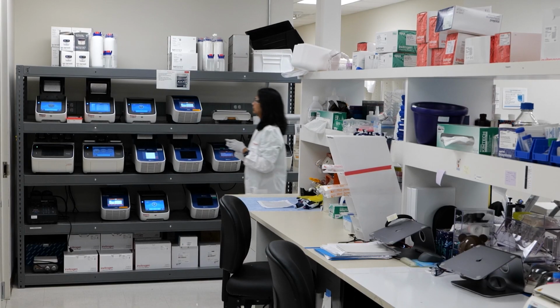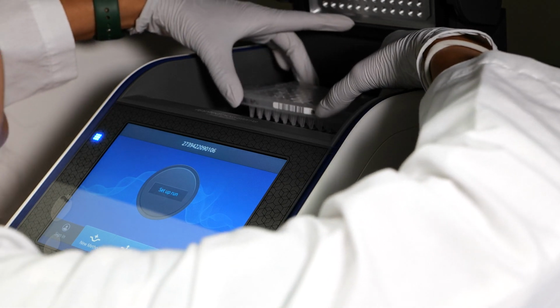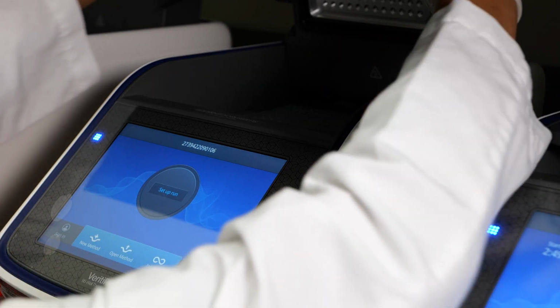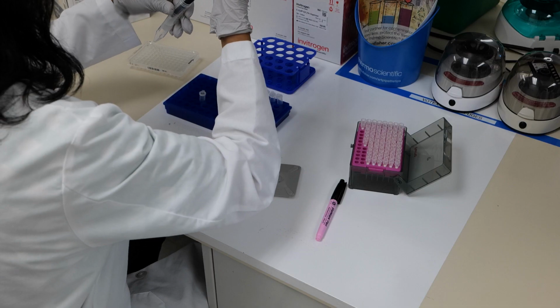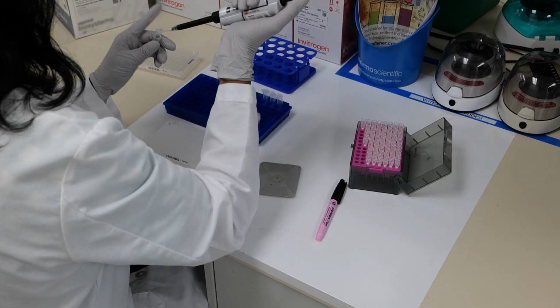To validate the success of this knock-in, an aliquot of cells must be collected and lysed before the PCR and gel electrophoresis is performed using the pre-designed verification primers produced by TrueDesign Genome Editor software.